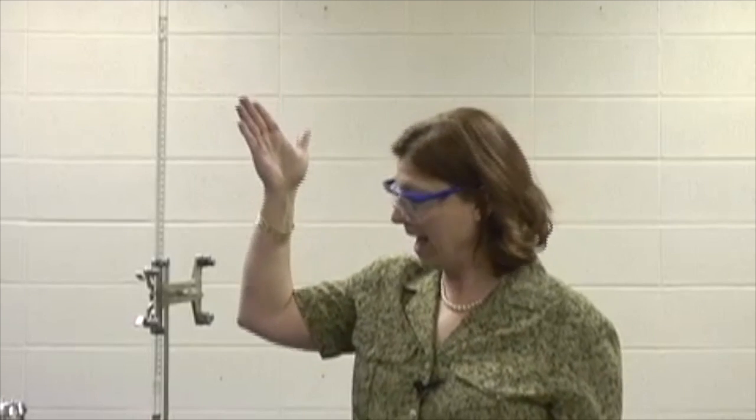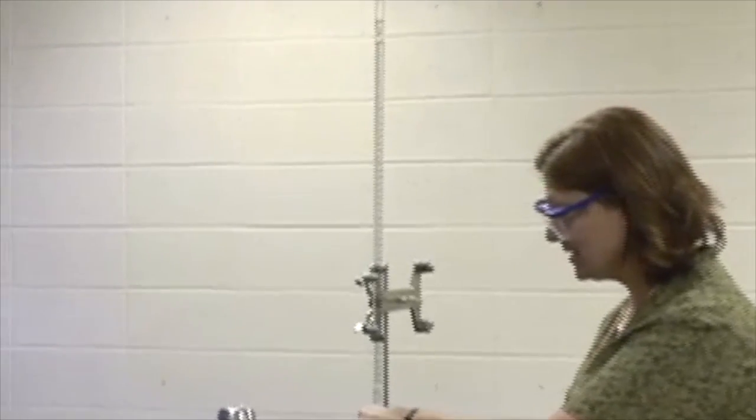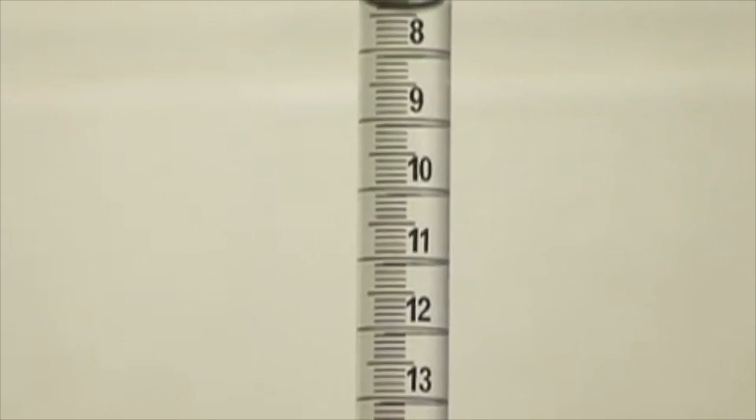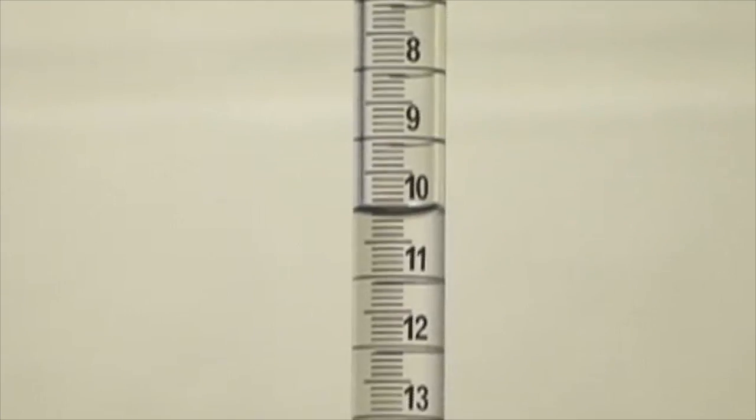Here we are for the final trial of standardizing my base. I have gone ahead and set up the burette at 0, and I have my Erlenmeyer flask with my 10 milliliters of 0.1 molar hydrochloric acid, 10 milliliters of distilled water, and my drops of the magic ingredient of phenolphthalein. Well, I know that it's going to occur around 10, so I'm going to go ahead and titrate here on down to 10 milliliters. Whoop! Now I'm going to go drop by drop.